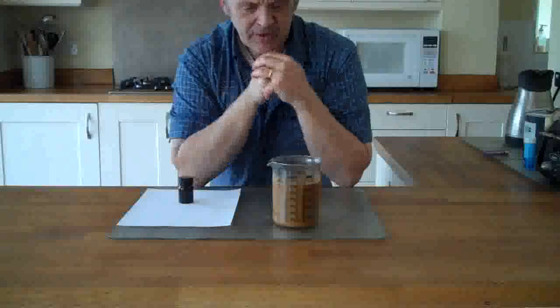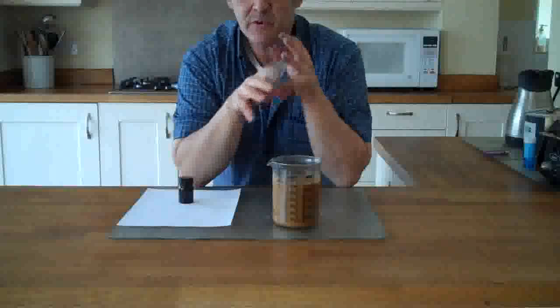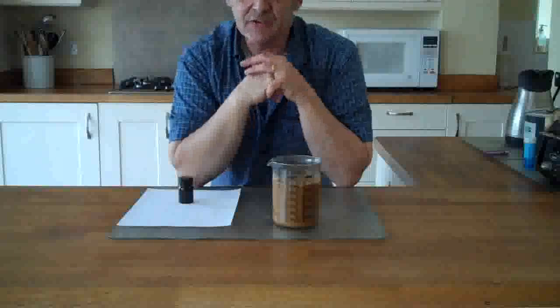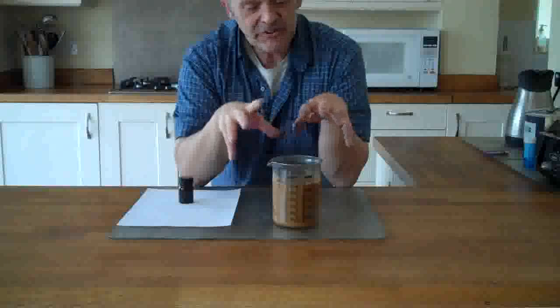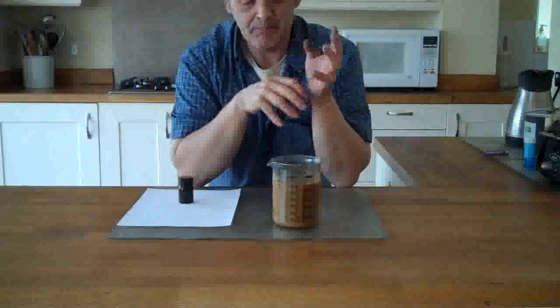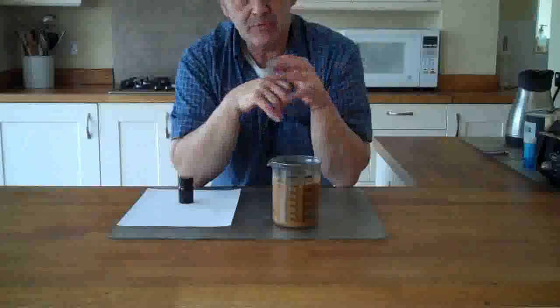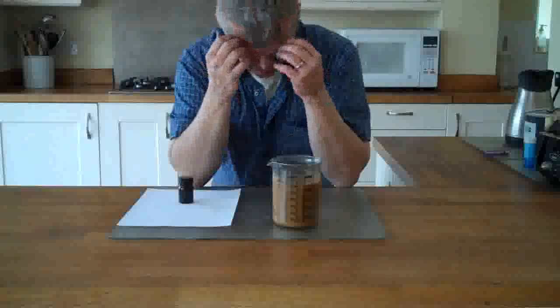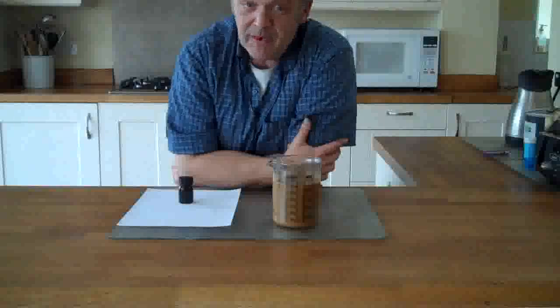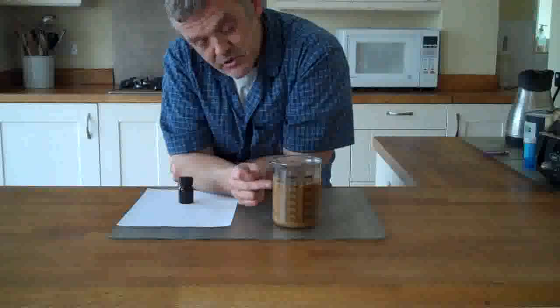There's a lot of other things in there as well as the graphene oxide - there's the potassium, the manganese, probably a bit of iron, quite a few other bits and pieces. So the next thing we need to do is wash it. Washing it is a dreadful procedure - if you wash it in liquid form, you'll be at it for weeks, because it's a nightmare. It doesn't filter very well and it takes ages to settle out, so you've got to get the pH to be neutral. I was doing it that way for ages, then I came across an article with another way of doing it, and adopted the new method - it's actually very much easier. Over the next couple of days or so, this will settle out.